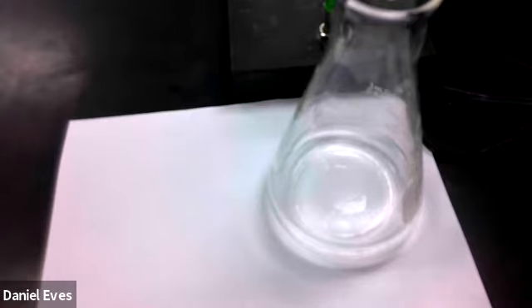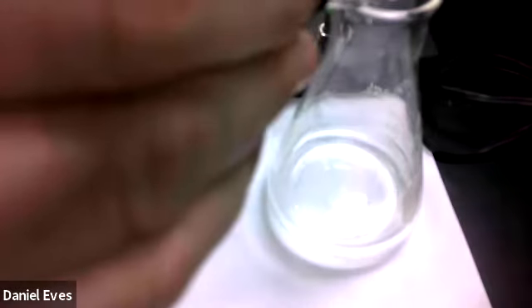Okay, so here is our solution with the requisite amount of potassium hydrogen phthalate. Hopefully you've calculated how many grams I would need to put in here to react with the required amount of sodium hydroxide. And so to this solution, I've dissolved all of the potassium hydrogen phthalate into water, about 50 milliliters. I'm going to add 2 drops of phenolphthalein. And that's going to help tell me when the reaction is done.